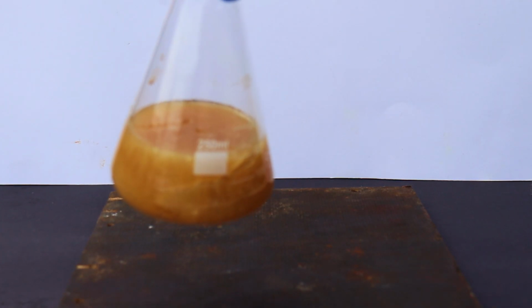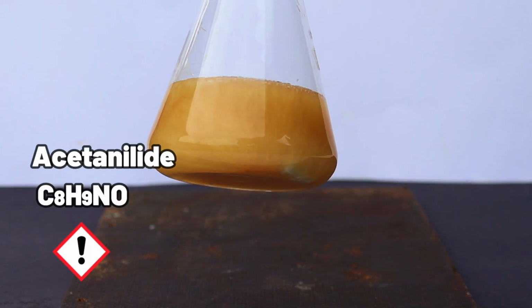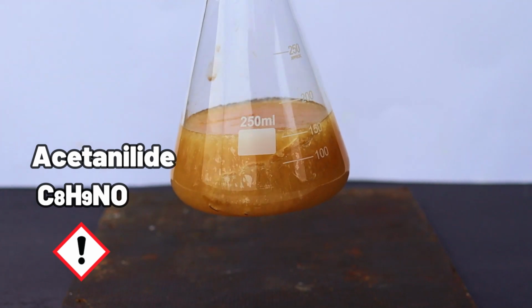After 2 hours, I stopped the reflux and allowed the mixture to cool down. As it did that, the whole mix solidified due to all the product crystallizing out.